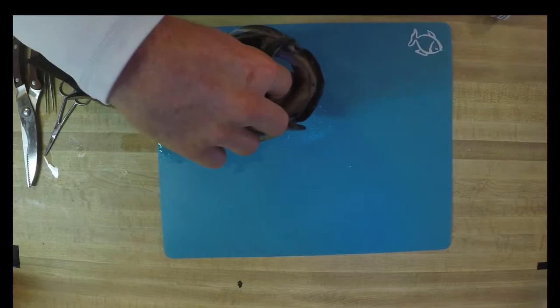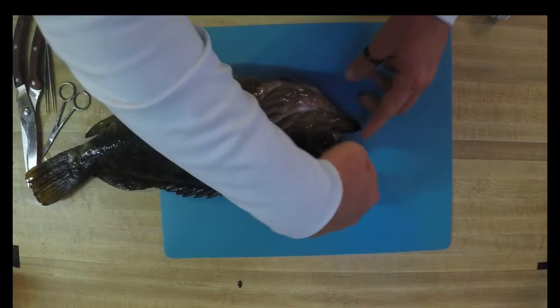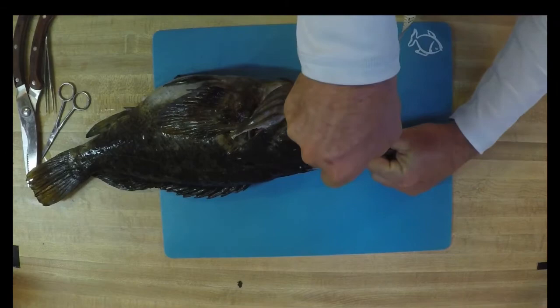If you're interested, you can also measure the gape of your fish's mouth and estimate what you think that fish might be eating. I've got about a three inch mouth — so three inches wide. Most fish can actually be quite aggressive with their prey, so even if an animal is only three inches wide, it could be like eight inches long. I've seen some fish actually have their prey still sticking out of their mouth as the very front of it is getting digested in their stomach. It's really crazy.